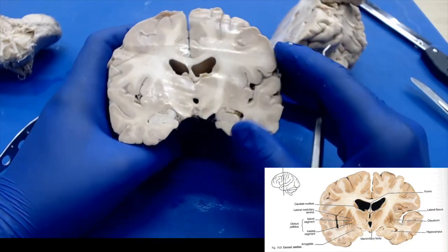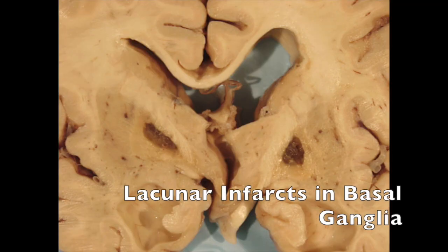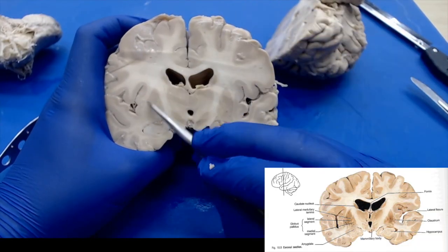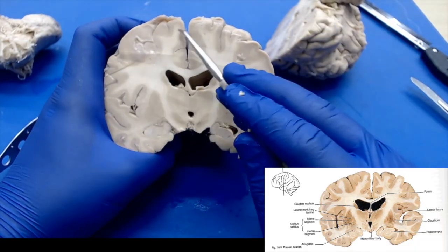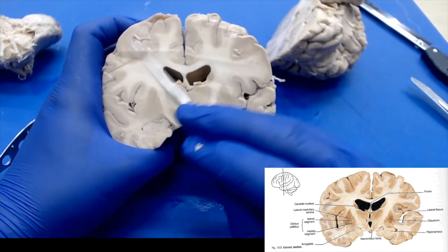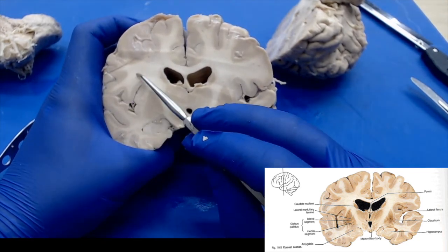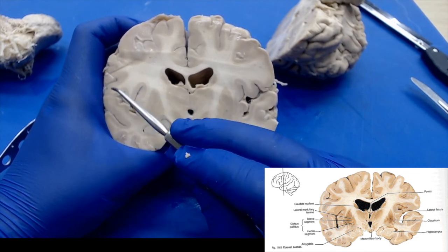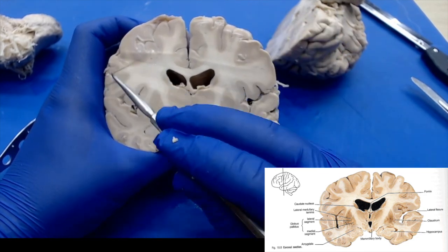They're little tiny infarcts in the basal ganglia, and those will cause some issues. So we'll take sections of that in order to manifest, see if there's any symptoms. And then we're just going to take some sections of our cerebrum. We want to include some white matter and some gray matter, so you should be able to see the characteristic difference between the two different matter types. So you can just kind of grab a section from the periphery there.